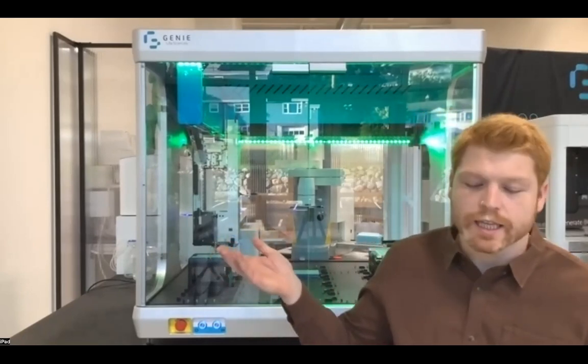So, anyways, what I'm going to be doing here today is walking through the products that we offer and how we're using them to address current needs in the market, focusing mainly around end-to-end applications and alleviating bottlenecks in automation that can exist throughout your lab space. So I'm going to start with our Genie LabMate, which is going to be controlled by our Genie LabOS cloud-based orchestration software.